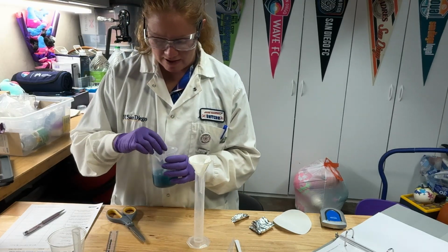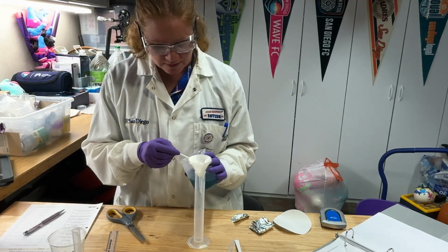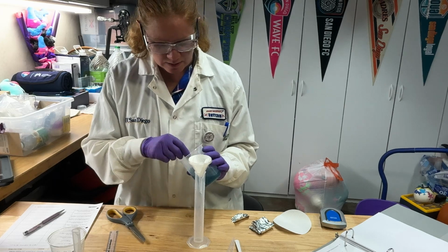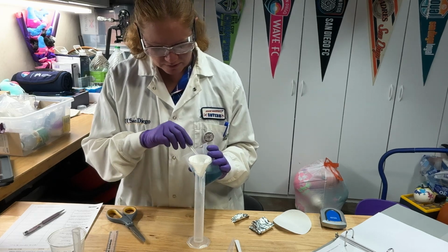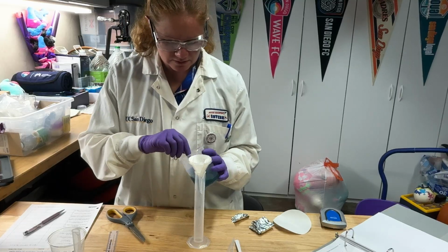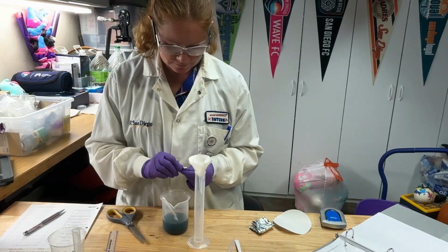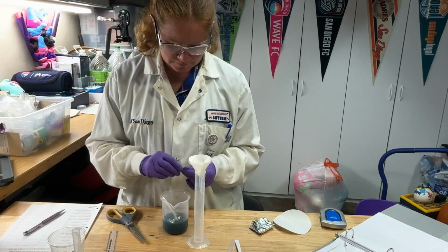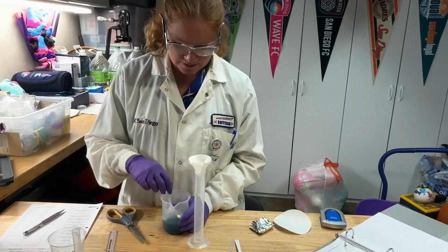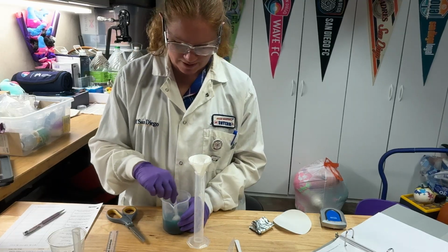Okay, now I haven't completely finished my reaction yet, but I want to show you a little bit of the filtering process. So I'm going to go ahead and try to get some of my copper out of here without using too much of my solution. Well, let me add a little more foil here. Definitely got a bunch of copper in there, but it wants to bring all the solution with it. Because I haven't really done a whole lot of reacting there.